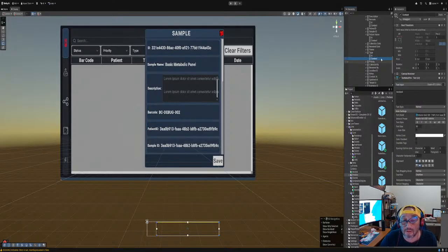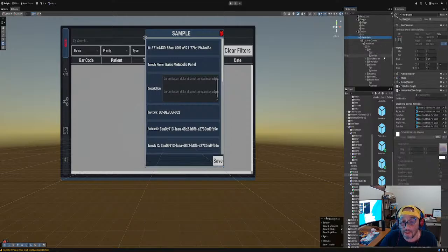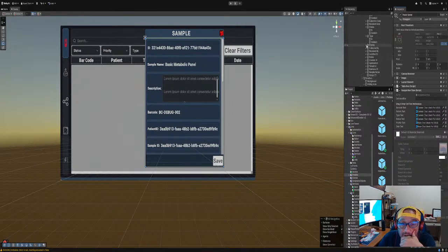All right. So then we go back up here, panel saved, and then we say type, and then we say status, and then we say priority. Priority was priority. We have priority. But we just add it right now. Yeah, we have priority. That's the content right here. And then we have the date. I'm gonna say the created date. I don't know why it just called the date.